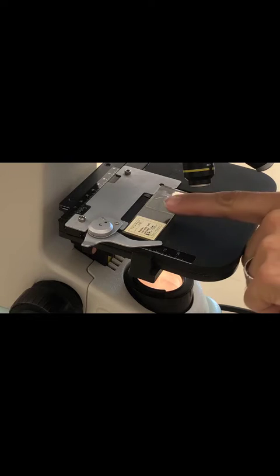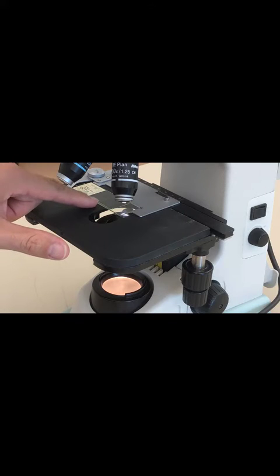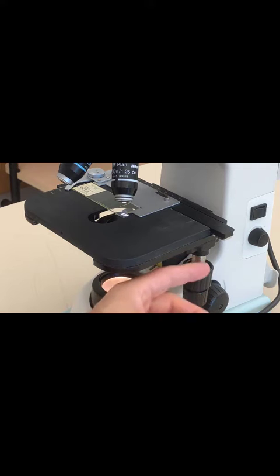Notice that the specimen isn't necessarily in the light path right now, so you want to correct for this. How do you get the specimen in the light path?